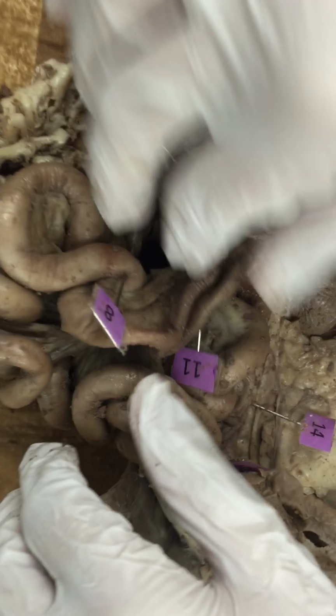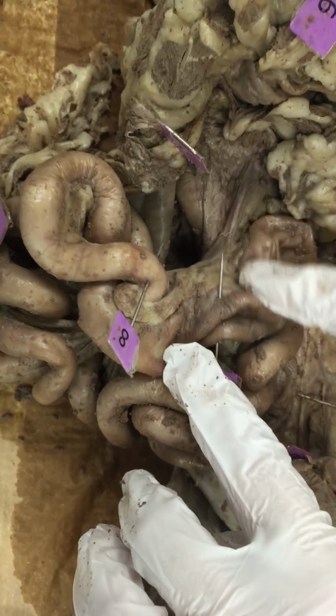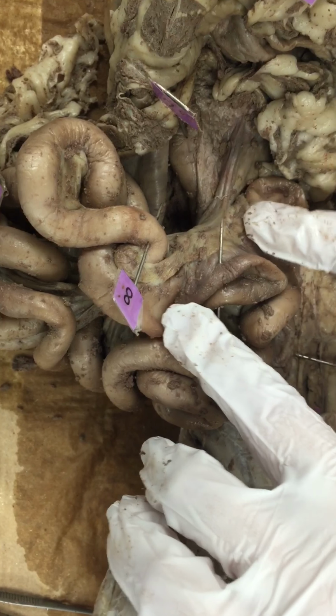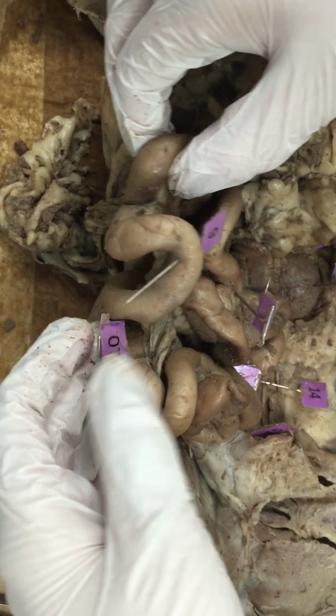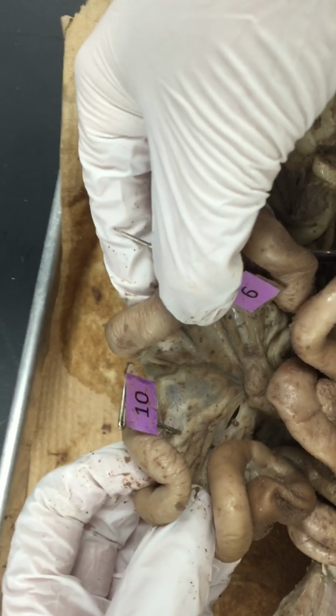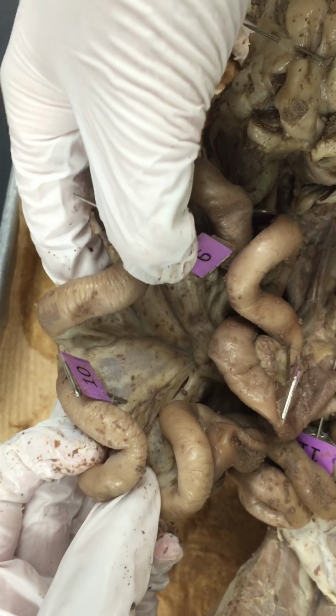You'll go to where your small intestine touches or connects with your large intestine, and that is your ileum. In the middle right here, just the parts between the 2 spots, is your jejunum. And if you fan out the small intestine, you see the fascia-looking layer right there, and that is your mesentery.